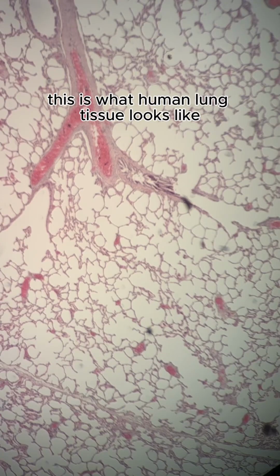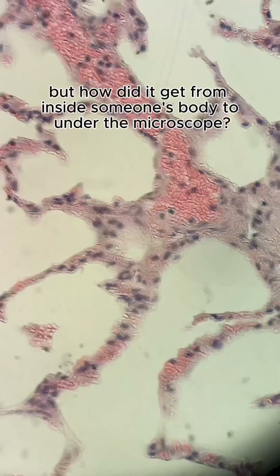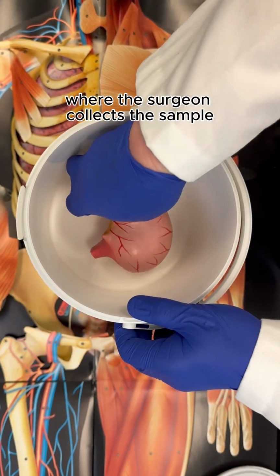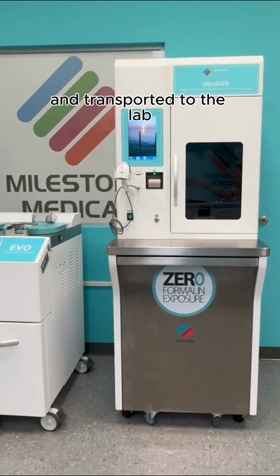This is what human lung tissue looks like. But how did it get from inside someone's body to under the microscope? Let's rewind. It all starts in the operating room, where the surgeon collects the sample. The specimen is then put in a container with formalin and transported to the lab.